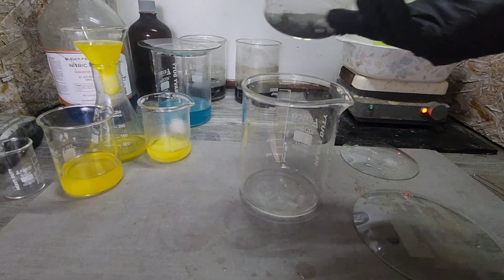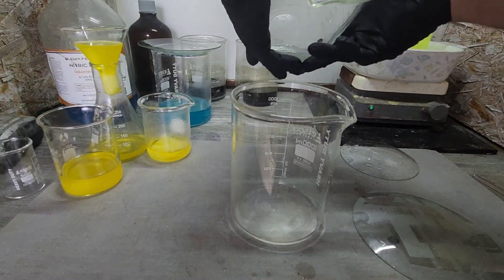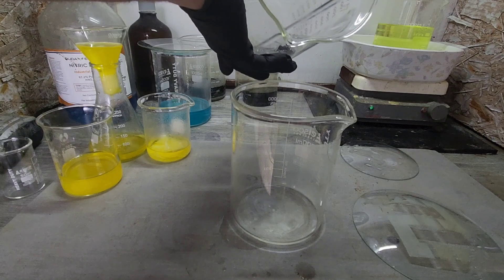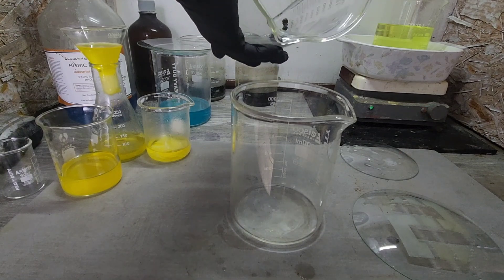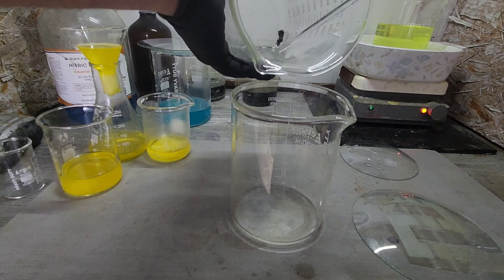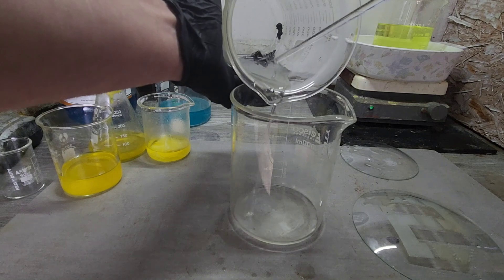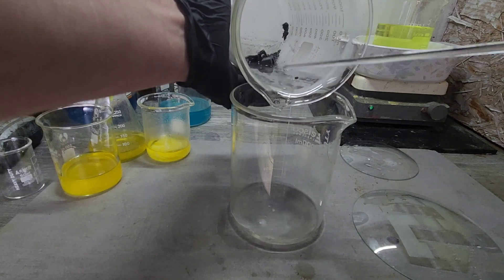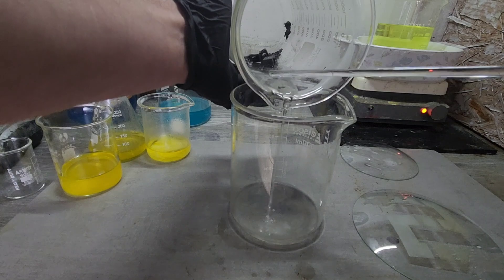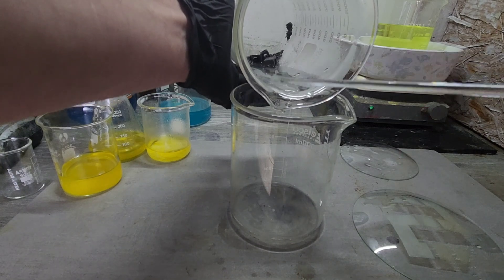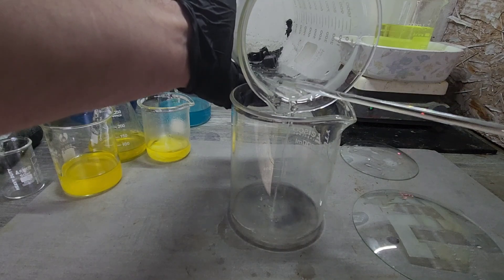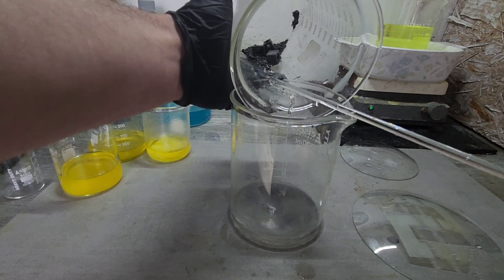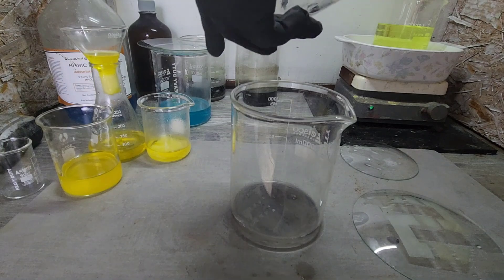So I think we are good to go on this front here. We got some floaters for sure. We're not going to get it all, no question about that, there's going to be some escapees.